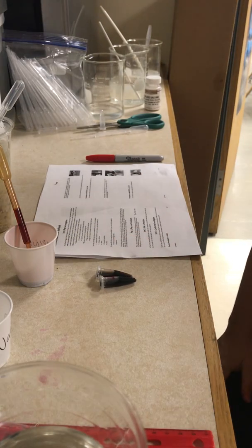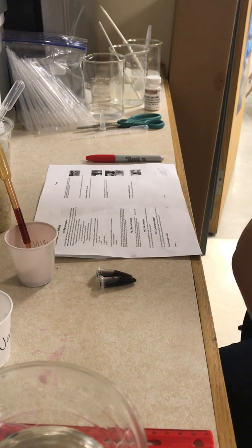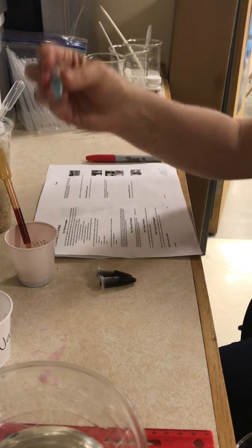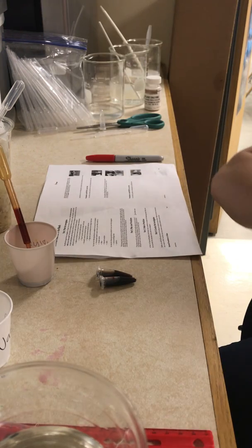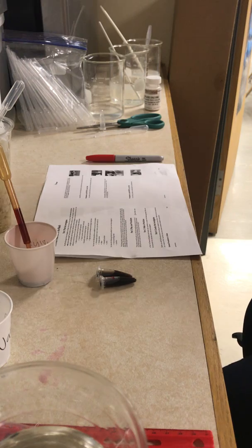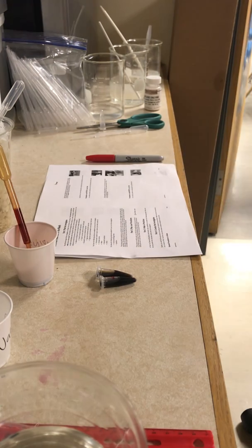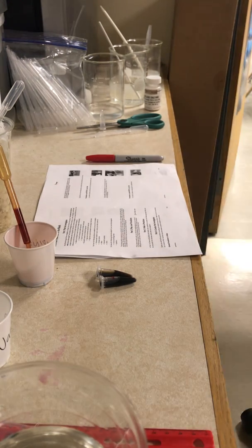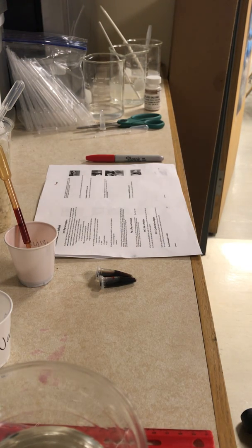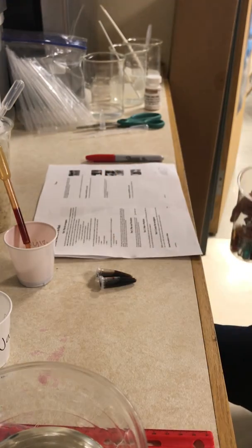After five to ten minutes, when you pull out the tubes from the cup, you'll see that tube C is blue, and tube D should have a bright orange or red color.